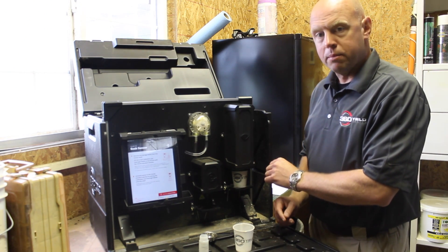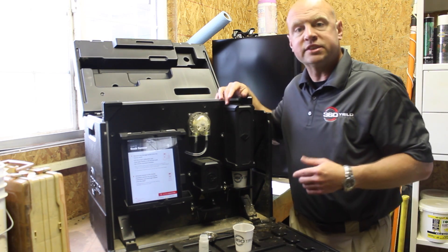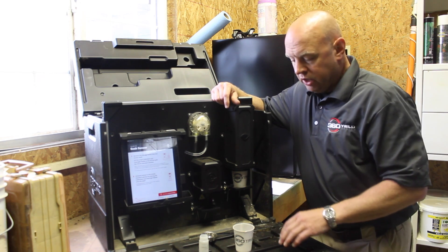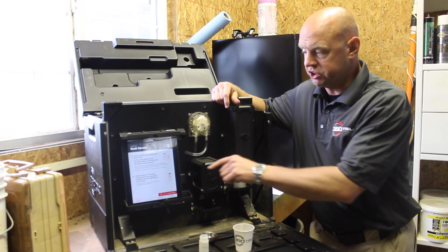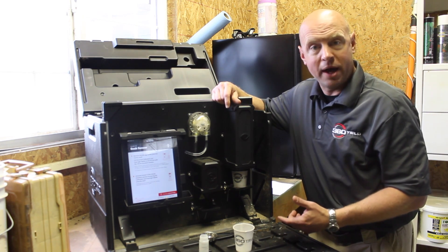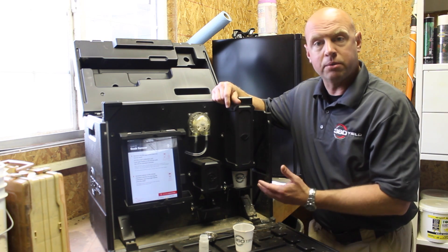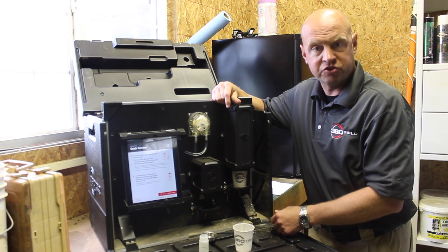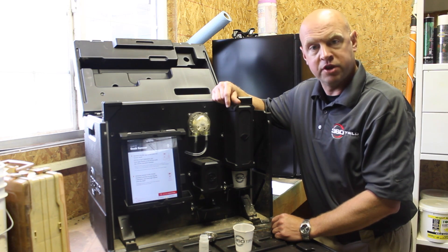The last comment I want to make is about the nitrate ion sensor tip. Over time it will fill with particles and start to get clogged. Starting around July 9th, with our next app update, we're going to have a function within the app that will allow you to test your nitrate sensor tip. You'll be able to see if it's green, yellow, or red — red means change it, green means you're fine to go, and yellow means you probably want to think about getting another tip on order.